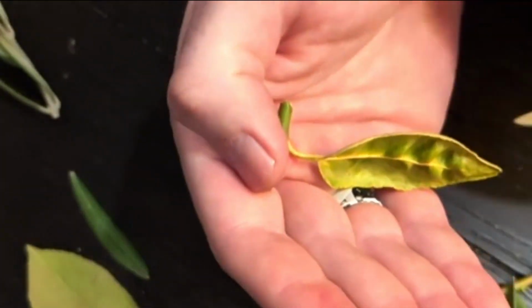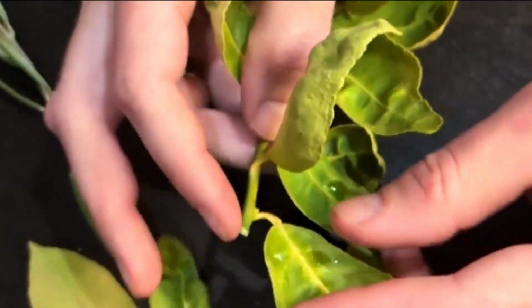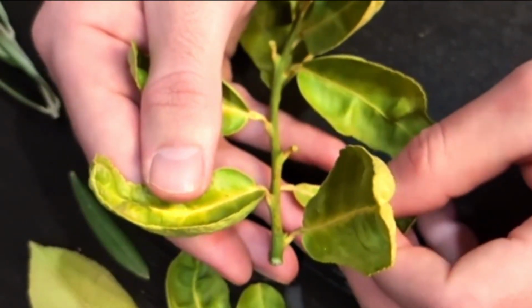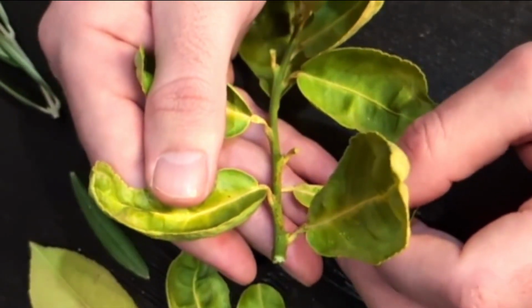They will typically go on opposite sides, so it'll alternate up and down the stem. You can kind of see that here. This one, and then this one on the other side, and this one, they kind of alternate back and forth. So that's alternating leaf arrangement there. Now, that's one leaf per node, and the olive was two leaves per node.